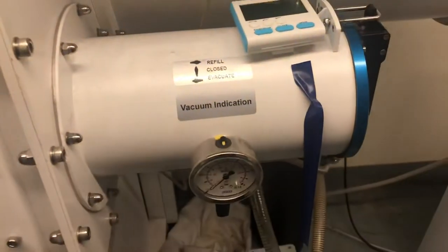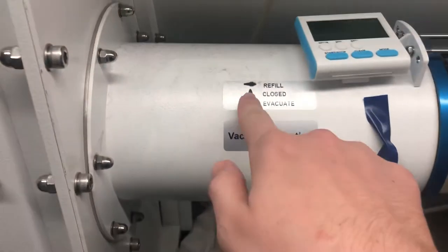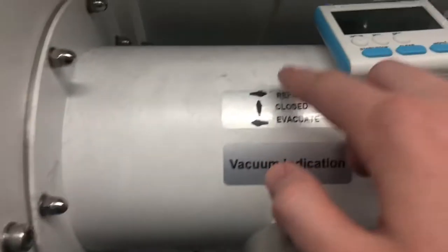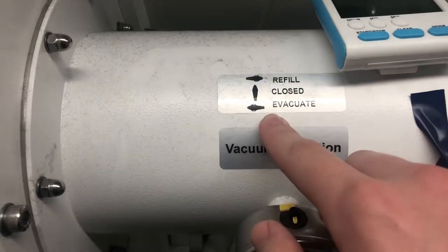When using the glove box and bringing something into it, please note refill is when this handle down here is in the orientation shown, closed and evacuated.